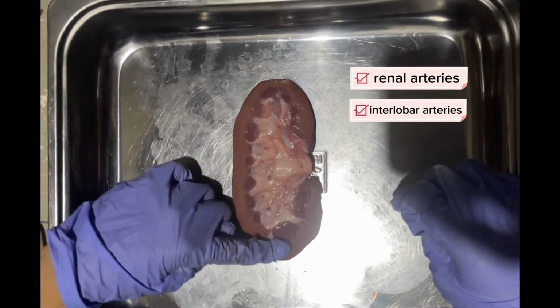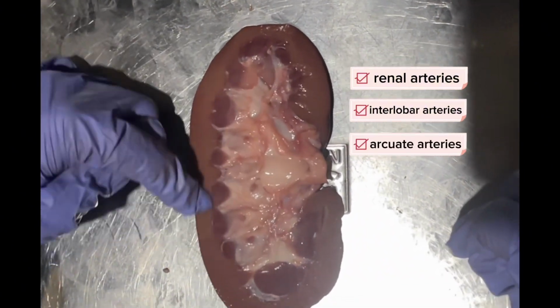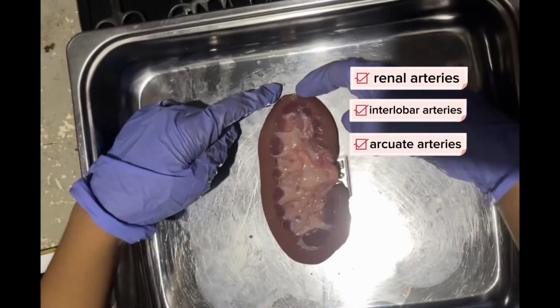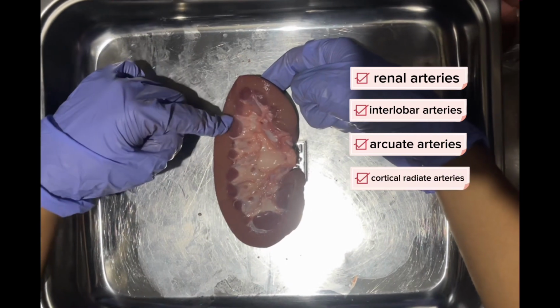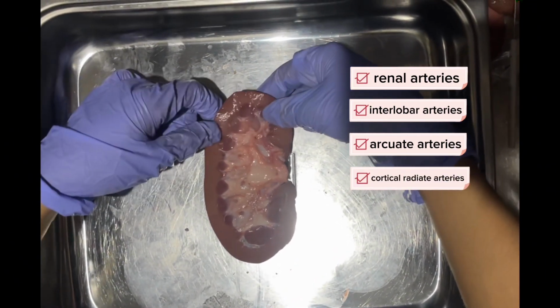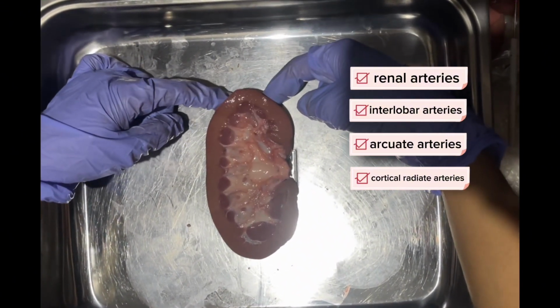after reaching the base of the renal pyramids, split off into the arcuate arteries. Then, it will further branch into the renal cortex as the interlobular arteries or cortical radiate arteries. These blood vessels serve multiple nephrons, where filtration of the blood occurs.